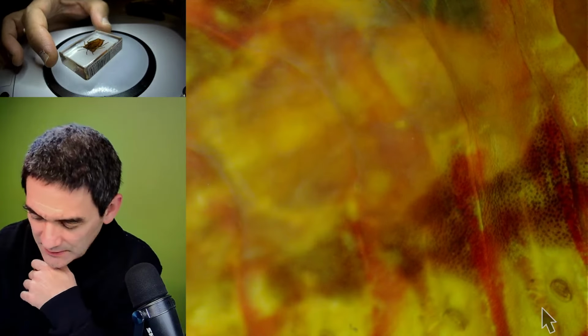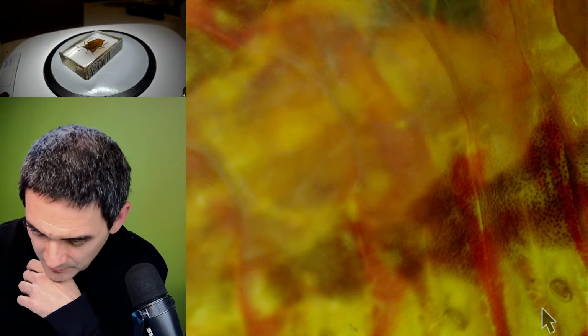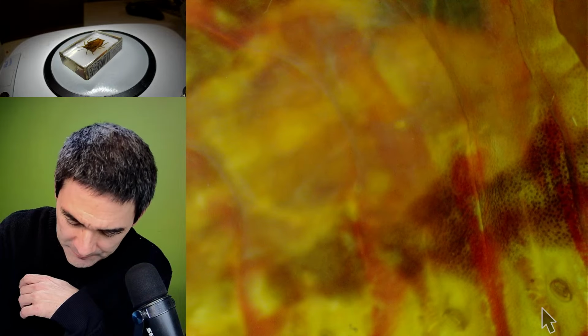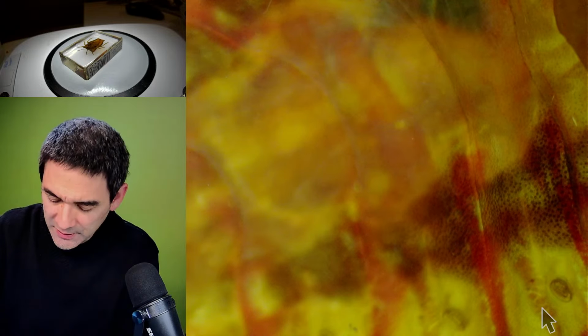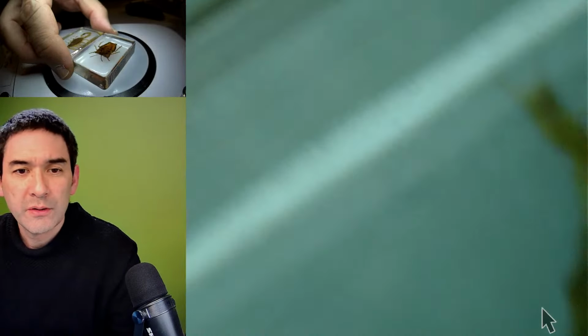So if this is the case, then maybe we can also try something similar with something else. I'm now going to choose another insect which is not too dark, not an insect, I'm going to go for the scorpion. Let's put the scorpion on here.